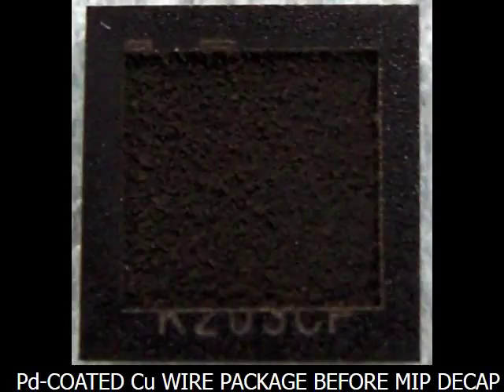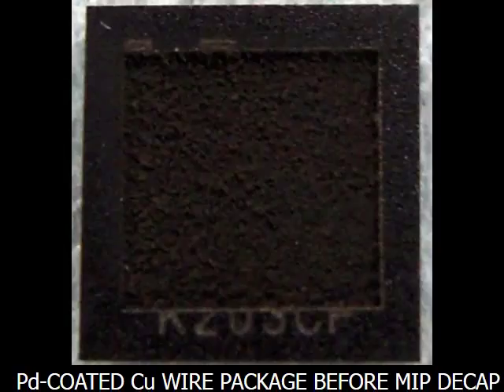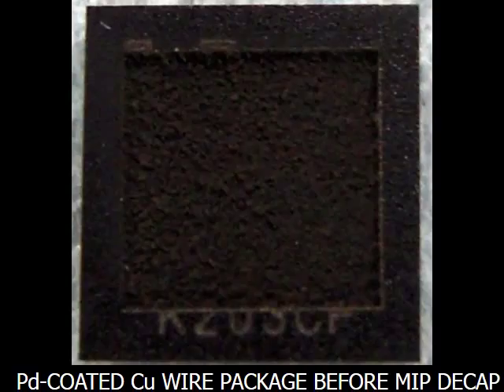We will demonstrate the differences between cold acid and MIP decapsulation based on this particular sample type. This sample has palladium coated copper bond wires and the epoxy moulding compound is of a type that is acid resistant. The photo shows the sample after being laser ablated but before MIP decapsulation.